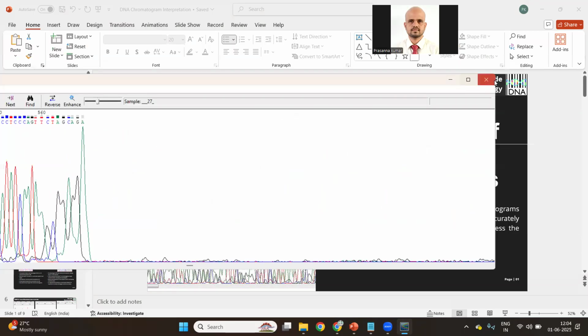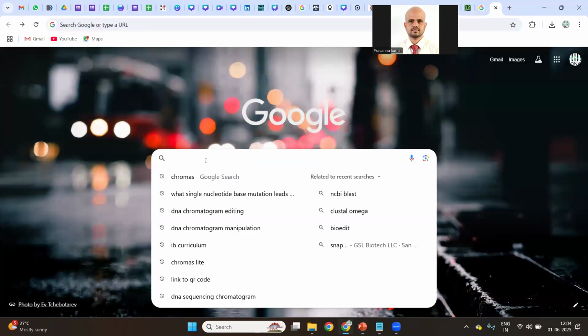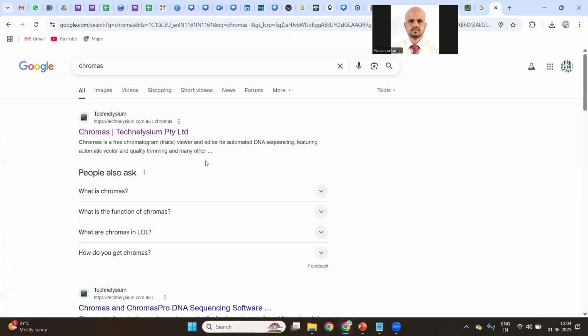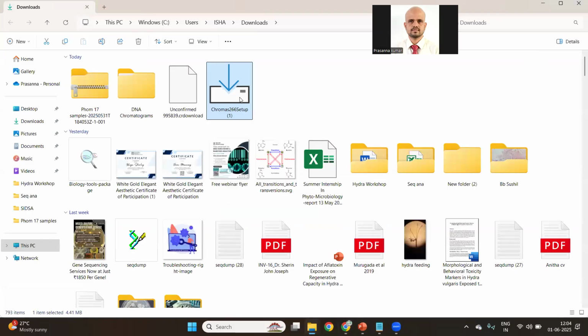I will demonstrate how to install it. This is a free program. Just go to Google and search for Chromas. Take the first option, technelysium.com.au. Go there. On this page, you will see there are two softwares. Chromas Pro, do not download Chromas Pro. Only download Chromas Lite. It is just 4.4 MB. I'm downloading. Download completed. So here it is.